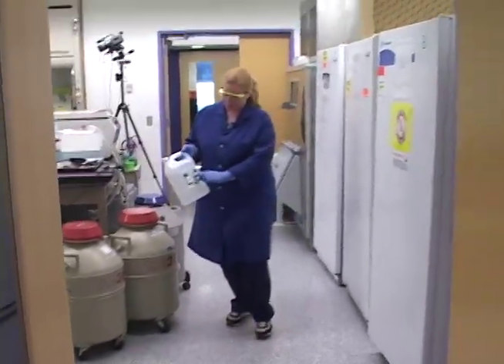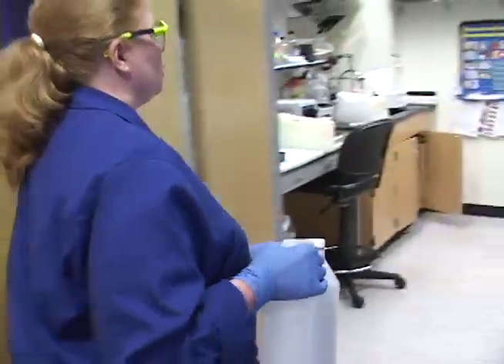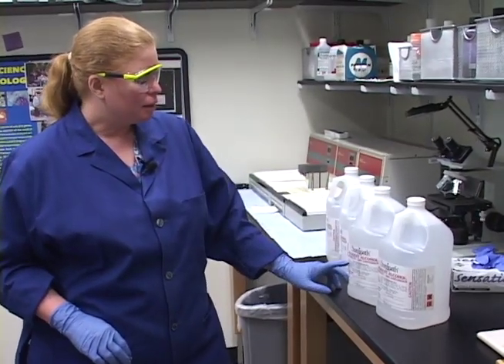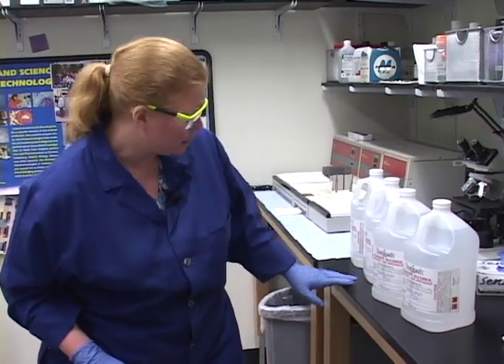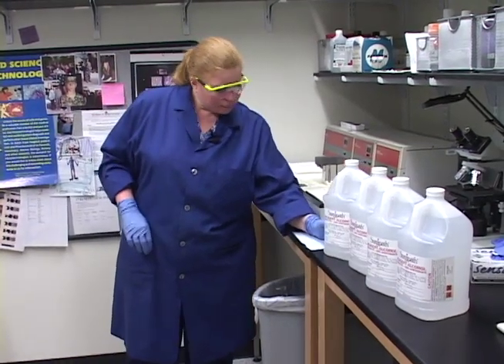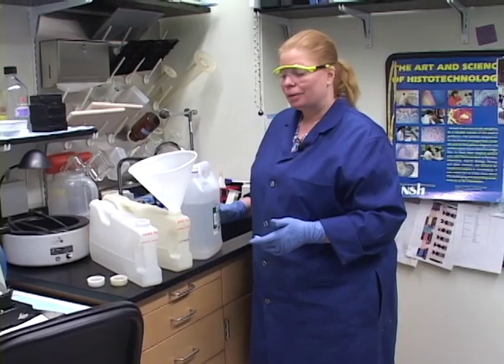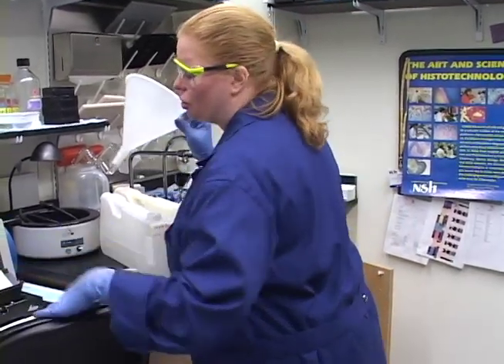For the actual other reagents, we use reagent alcohol. We found that for this oral tissue, this reagent alcohol seems to be a little bit better. It's a blend of ethanol — mostly ethanol — but it has a little bit of isopropanol and methanol in it. That little bit of blend seems to work very nicely for our tissue. Plus, I don't fully trust the bulk alcohol from the dock — you don't know how it was handled, how long it's been sitting, where it came from, or how clean it is. I just don't like to use that for our actual research tissue.